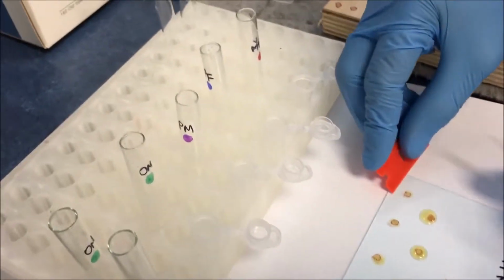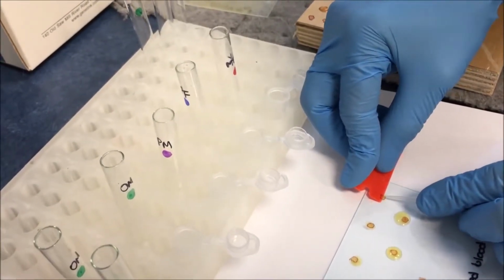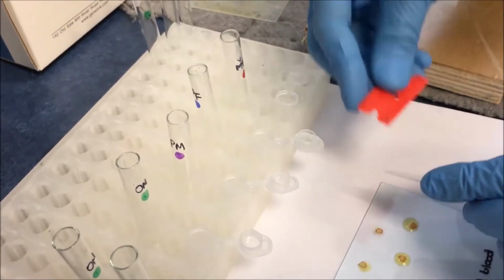We use what we call a scraper. So we scrape the area where we see the boundary of the Omni-Matrix. Can you hold just 1 minute?